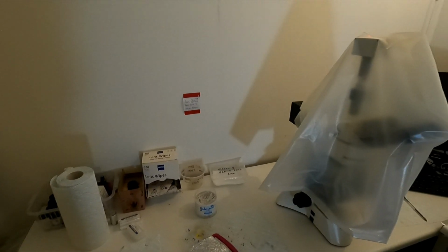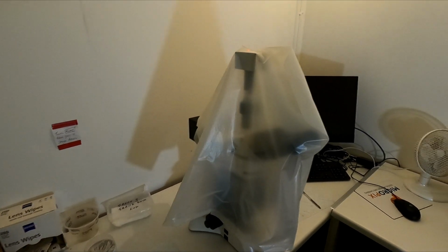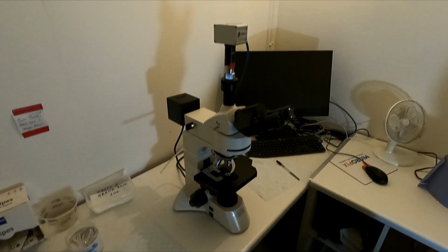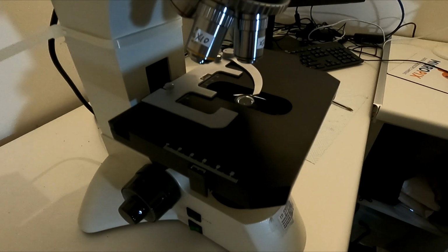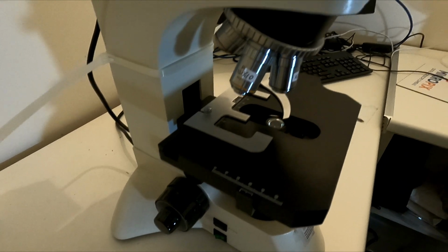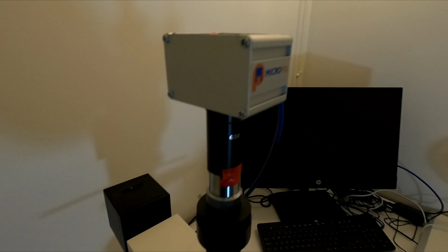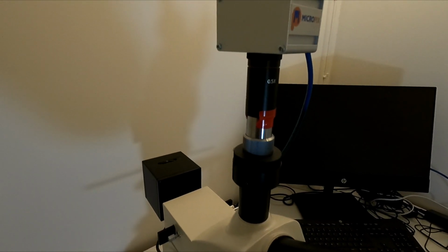And that brings us to the final part of the tour, which is the piece of equipment through which all the lab work goes, and this is our main microscope. I've shown in a couple of videos previously me using a microscope. This is the main one that we use. A couple of important things about it. One, we've got this cool camera connected, so at some point I'll take some pictures or videos and share them with you guys. If there's things you want to see, do let me know in the comments below.